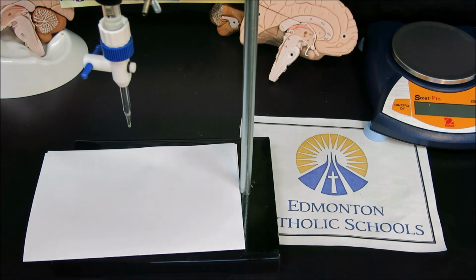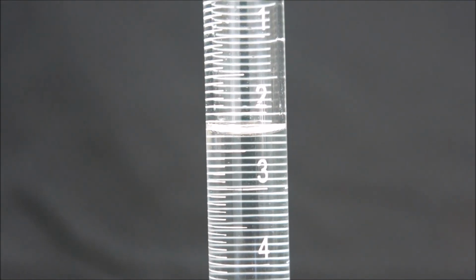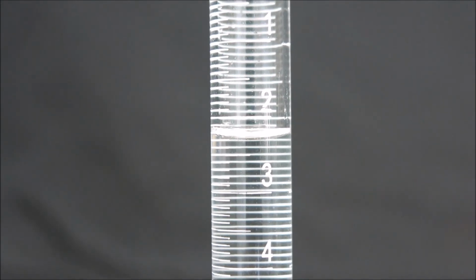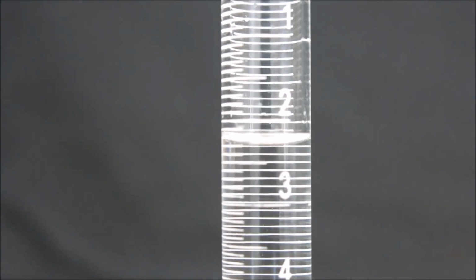Now for this lab, as it is an online lab, students will be expected to record volumes off of a burette. So I will take the camera and zoom in on the volume that is now considered the initial volume for this first titration, and you will record that into your data book. For this first reading, I'll help by explaining the 2 milliliter mark is above and the 3 milliliter mark is below. This is because burettes are basically a graduated cylinder that's upside down. So we're actually increasing volume as we go down the tube, because that is the amount of volume added into the sample.